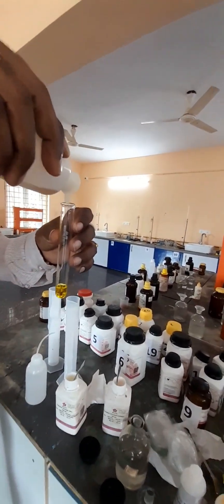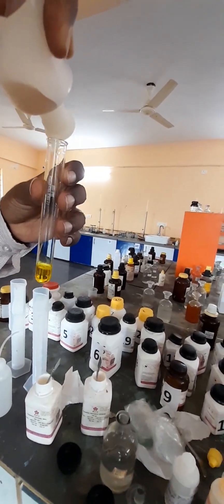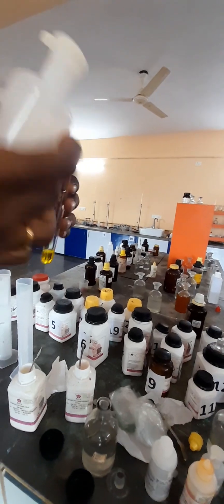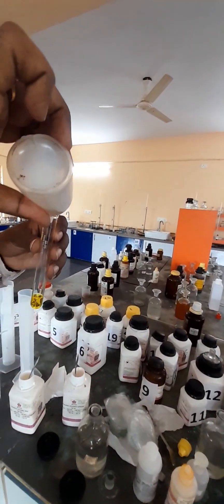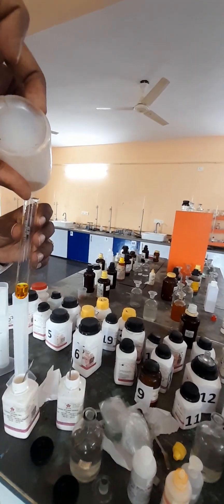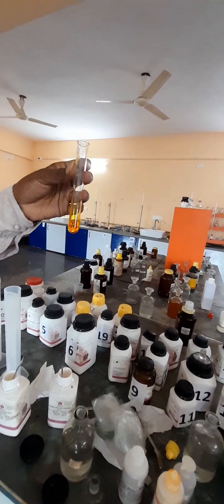I am going to add concentrated H2SO4 here. After adding concentrated H2SO4, you can clearly observe the development of the orange color.